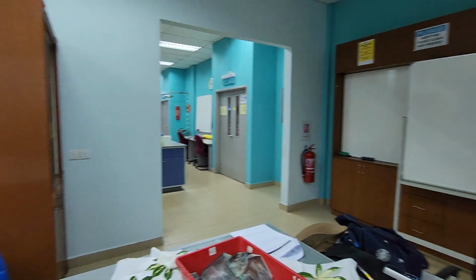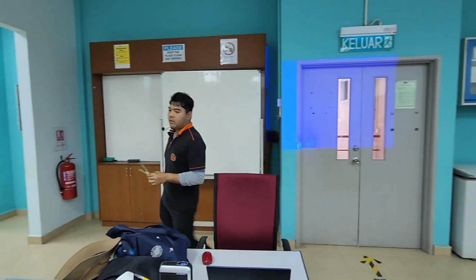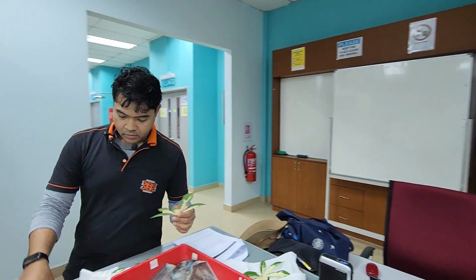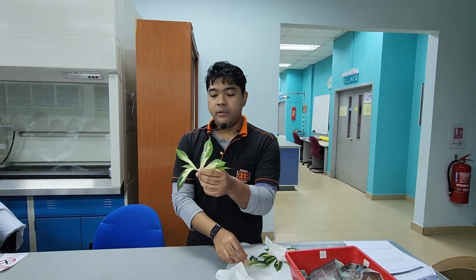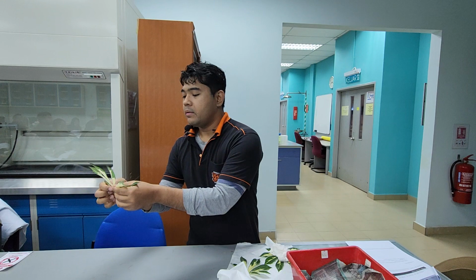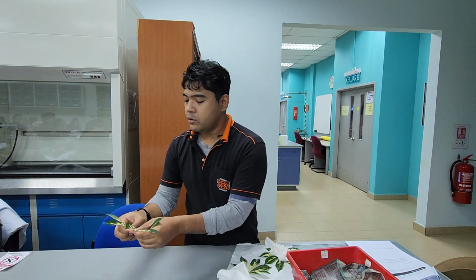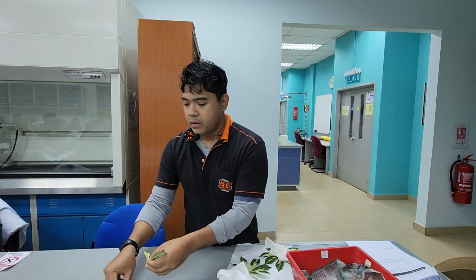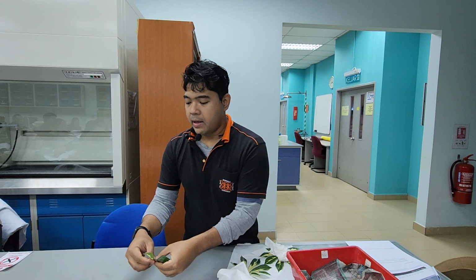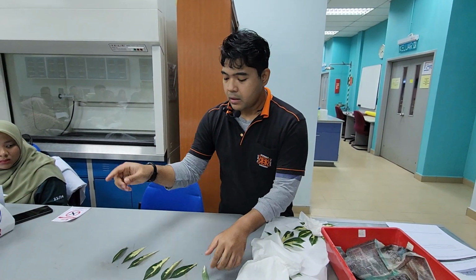So if you get a specimen which may be not flat, maybe something like this, and you want to save time, you can actually remove the finger. Remove the finger, but you need to remember how many fingers you have removed, and then you can just add up the leaf area of it. Okay.